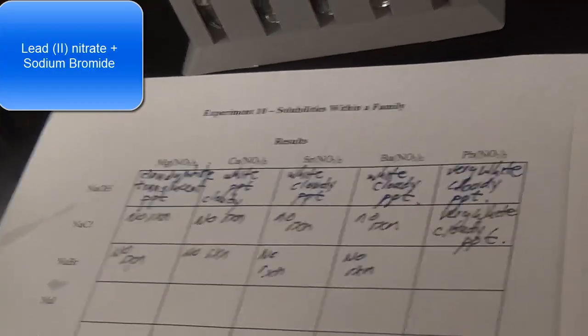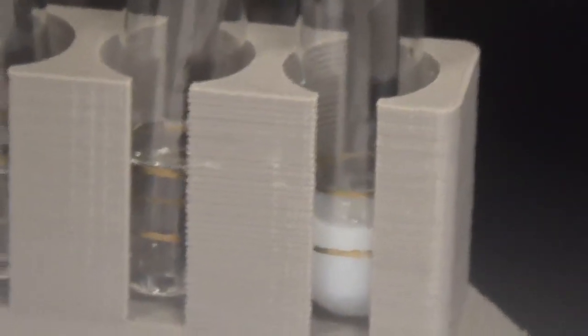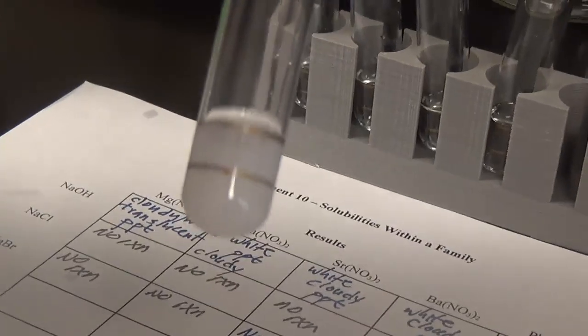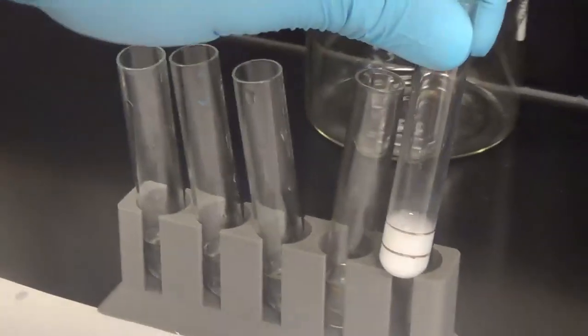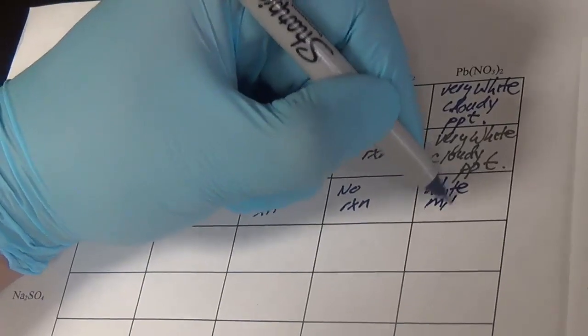Okay, finally, lead nitrate with sodium bromide. This will be lead 2 bromide. And we definitely have a reaction going on here. Call it a white milky precipitate. Looks like milk to me. Again, your observations may be different. So white milky precipitate, lead 2 bromide.